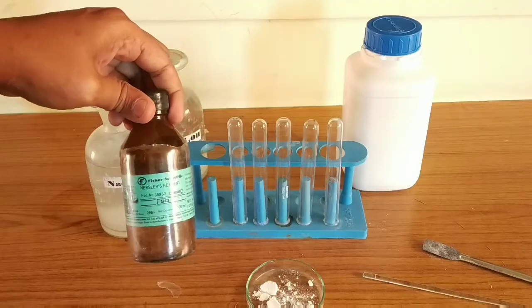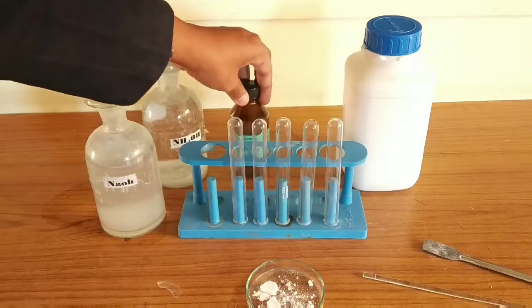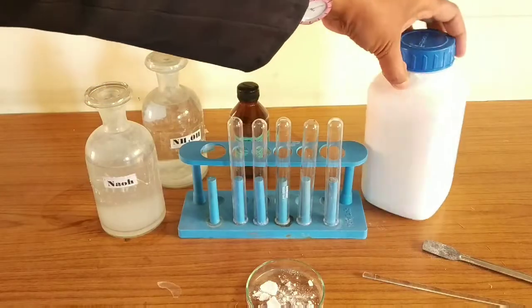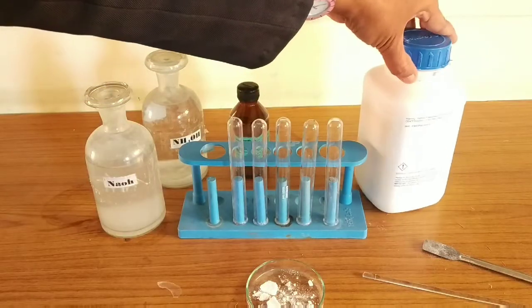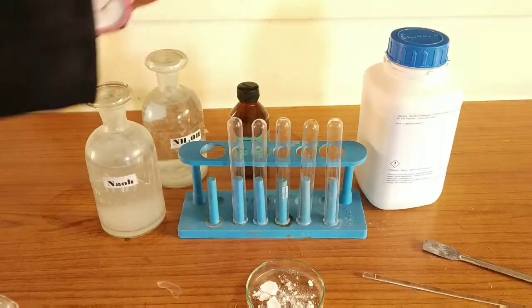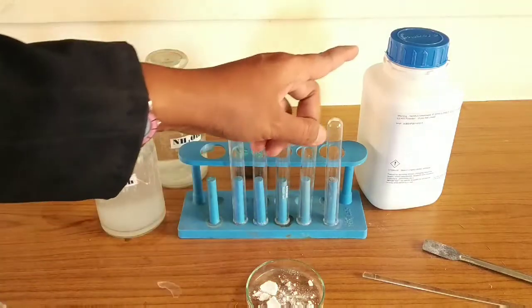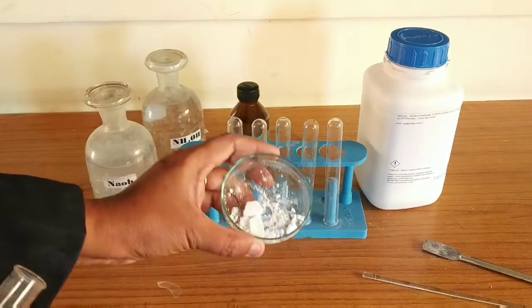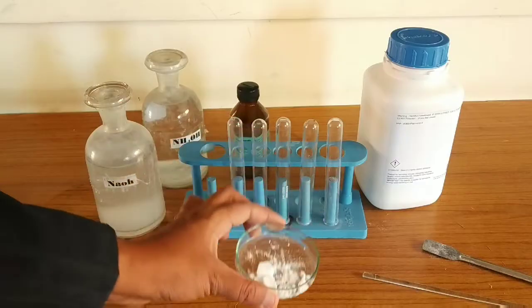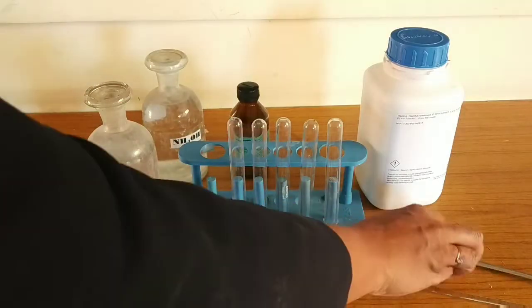Nessler's reagent has the formula K2HgI4. Here I have taken a salt — I'm not showing you the name of this salt just yet; I will reveal it once we perform the test. I take the salt out onto a Petri dish.